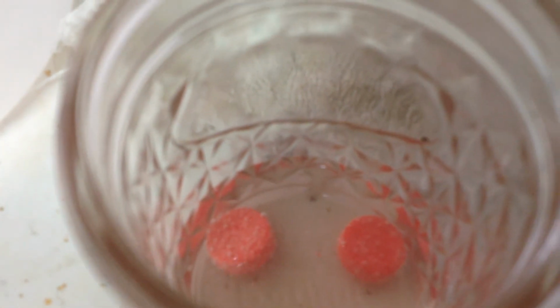This is our third, and look at that one. Definite bubbles. We're going to kind of swirl it around, help it react. So you want to think about which one of these is producing the most bubbles. Again, if you listen close, you can hear them kind of fizz. And those are the 2 whole tablets in this one. We'll shake them a little bit too. Give them a chance. So which one seems to be producing the most bubbles?